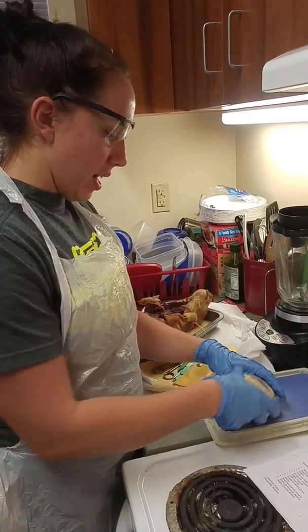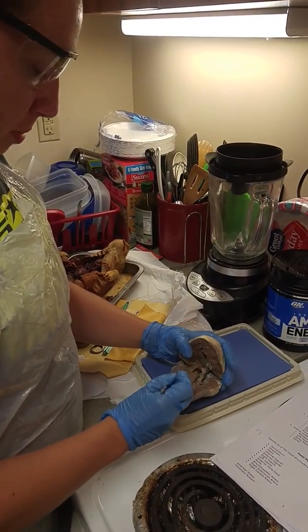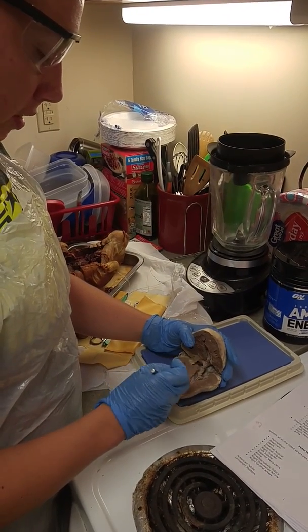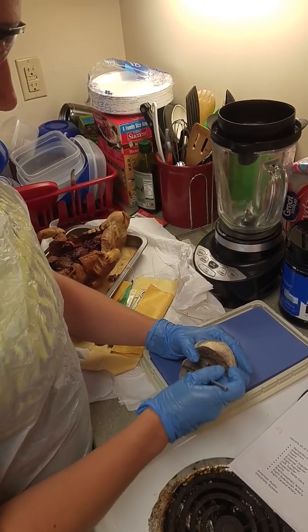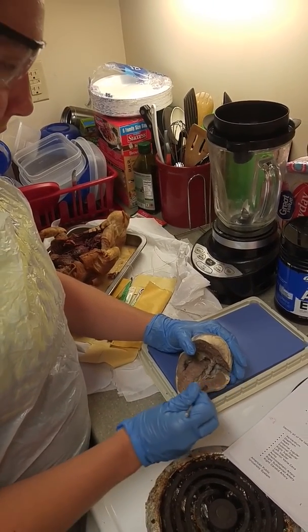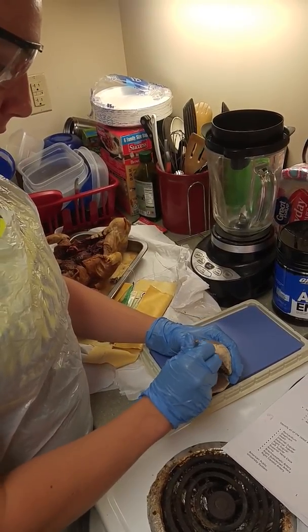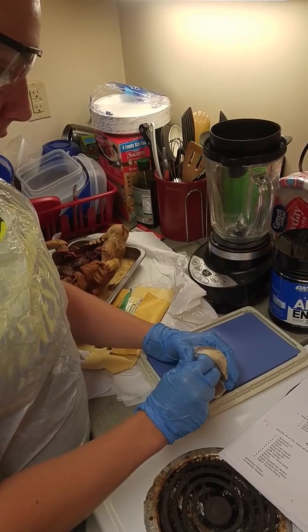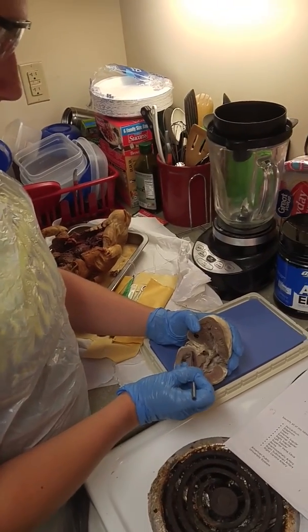On the inside, this is the right side of the heart. We can tell because the muscle is thinner on this side, and the myocardium is the muscular tissue inside the heart here. The endocardium is the thinner third layer inside of the wall of the heart here. The right atrium is on the right side of the heart at the top here.